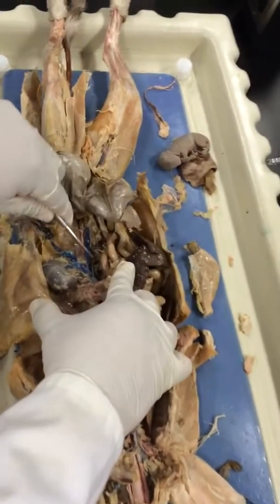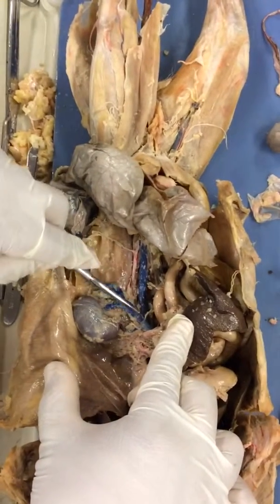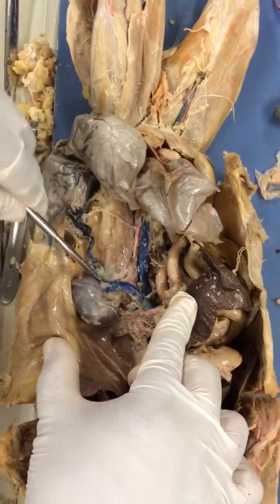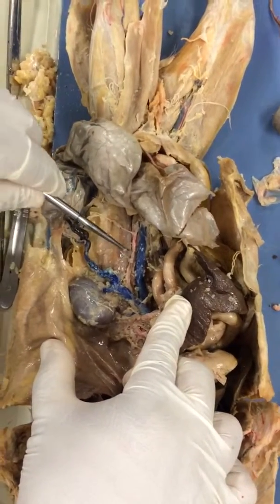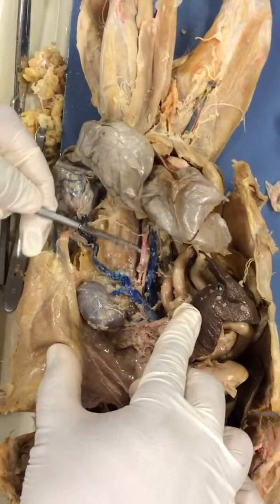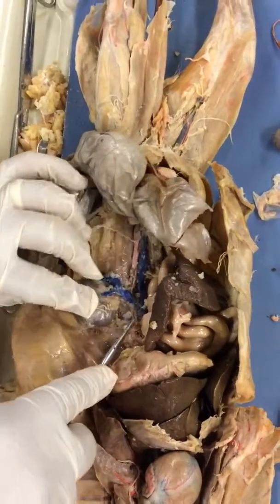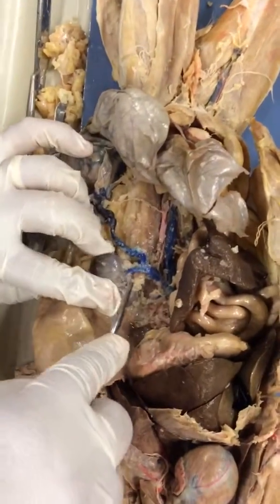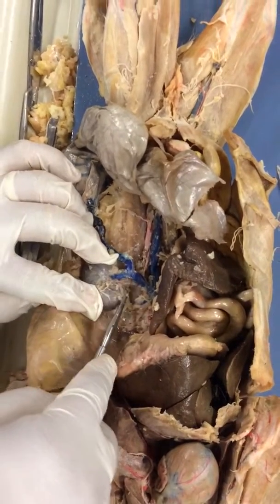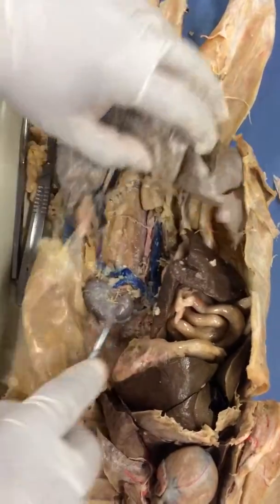Now you guys can't see it over there, but it's going to be the large central blue vessel. Inferior vena cava. Just lateral to that, or just inferior to that, you have the large red vessel. How would that be? Abdominal aorta, right? Fairly large blue vessel making its way towards the kidneys. Renal vein. And deep to that, you have the red one here. What is that? Renal artery.